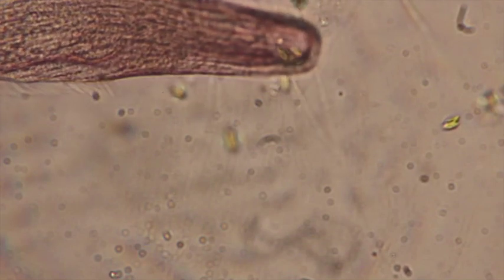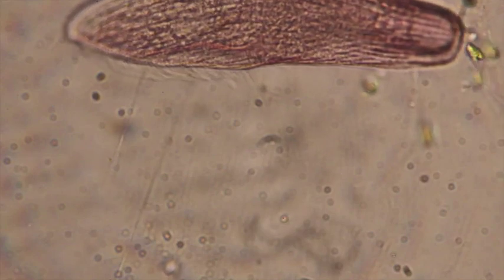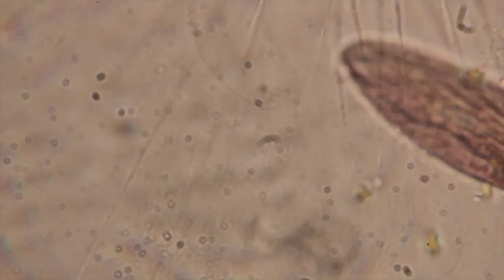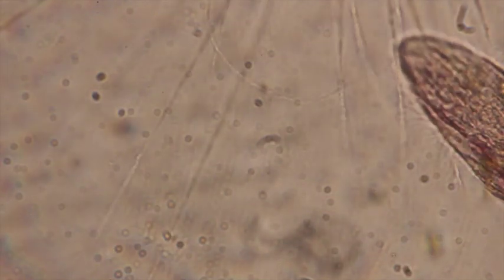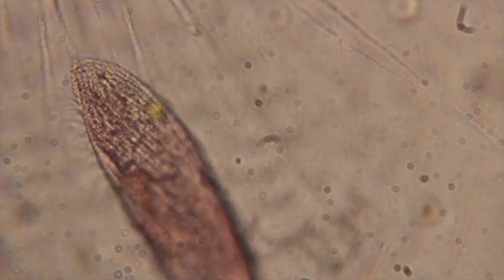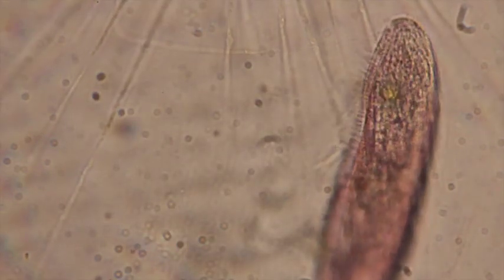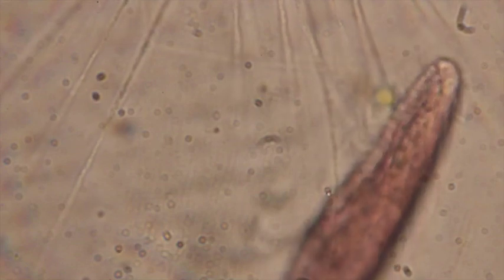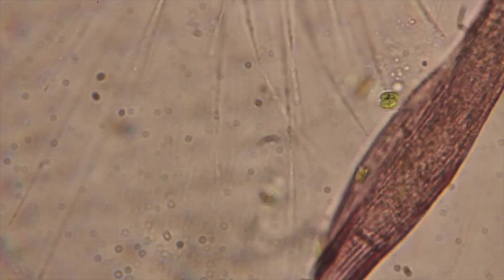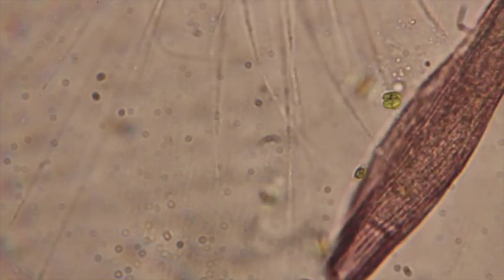Now there are photos of actinosphaerium eating a lot larger things, and there are some photos of actinosphaerium eating a blepharisma of this size, but you really see a lot more of the blepharisma feeding around the axopods than you do seeing the blepharisma being engulfed by the actinosphaerium. So the actinosphaerium is a predator, but it mostly preys upon smaller organisms rather than the blepharisma.